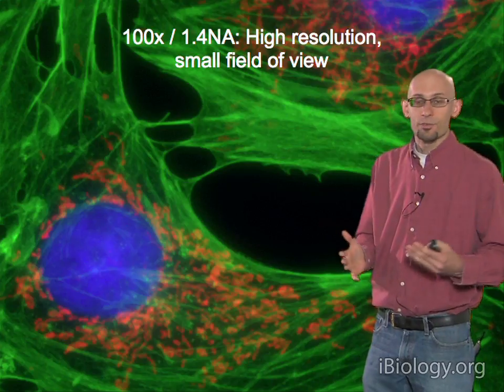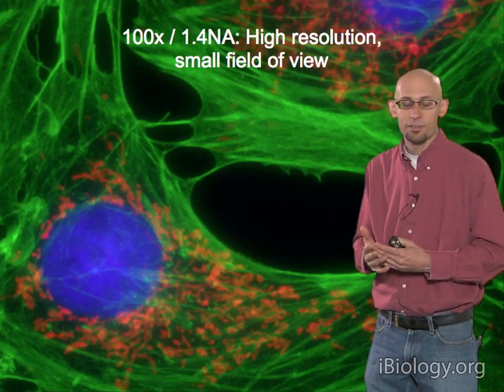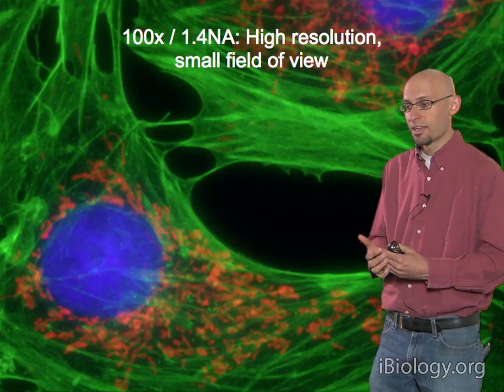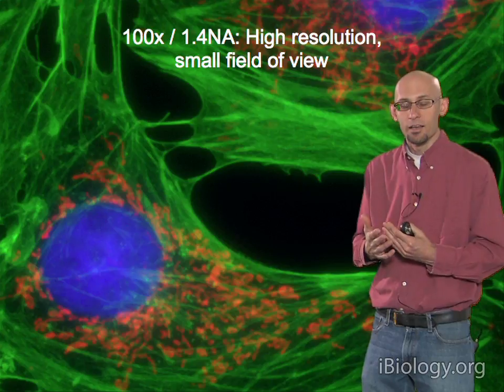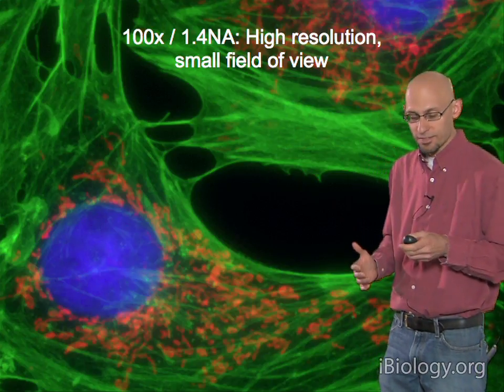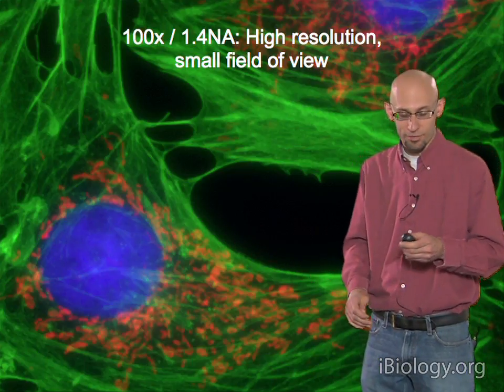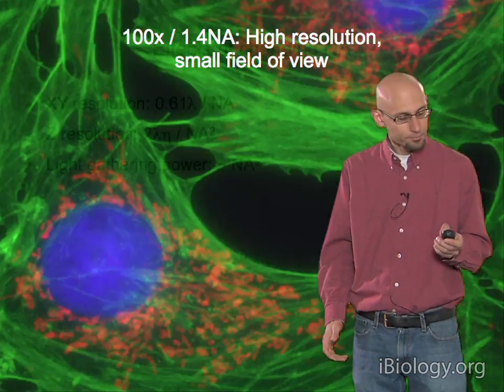There's a trade-off here. If you don't need high resolution, you'll want to stay with lower magnification and lower NA lenses to get a bigger field of view and better statistics. But if you need high magnification and high resolution, you'll have to accept the small field of view.